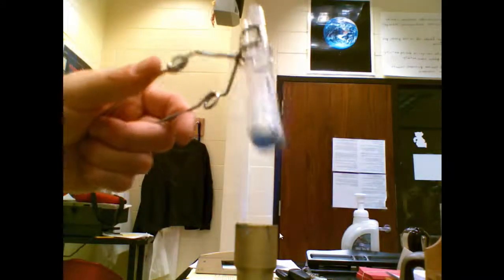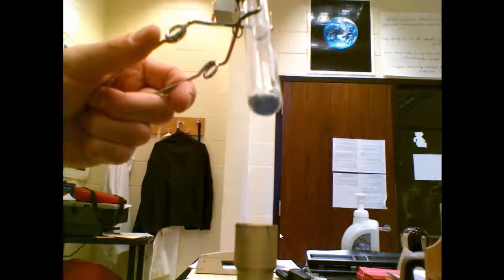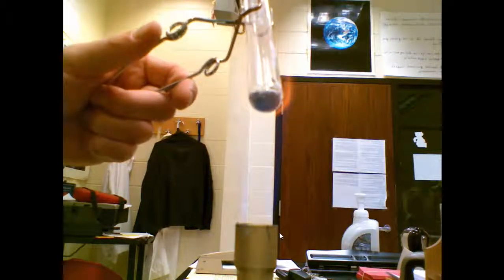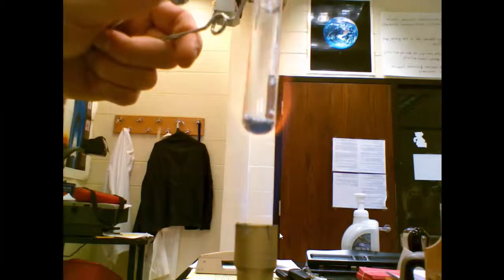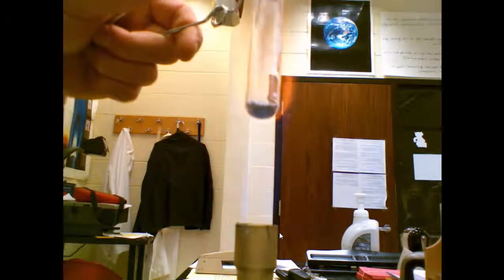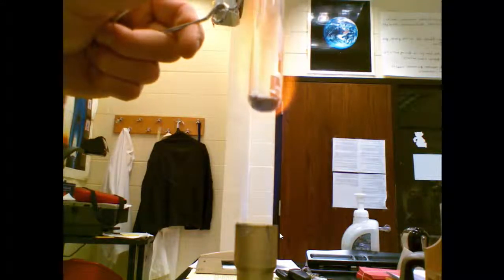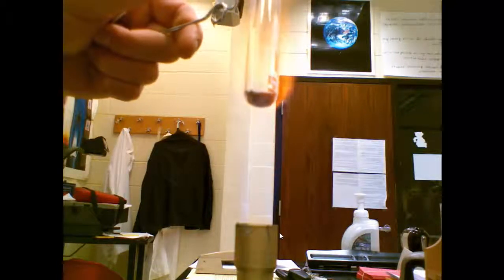Crystal number four, silver colored, looks like filings. Okay, flame's beginning to turn yellow. No sign of melting yet. Still no sign of melting. This sample didn't melt in our Bunsen burner.